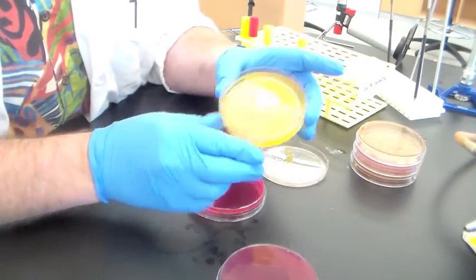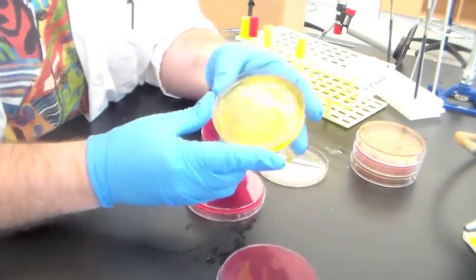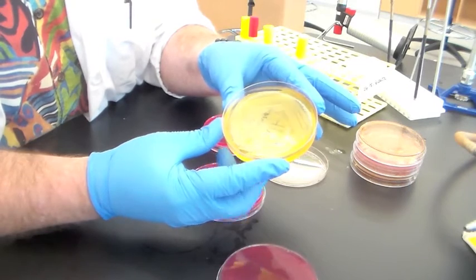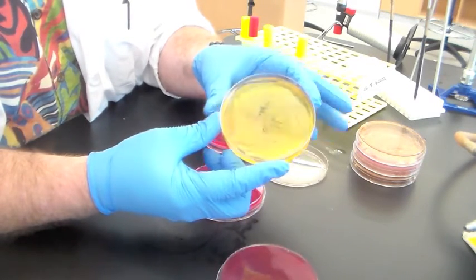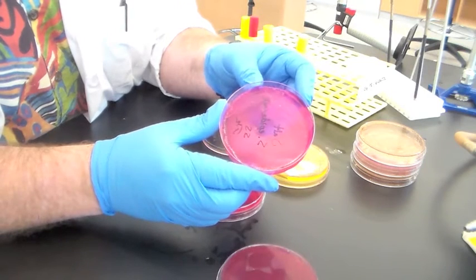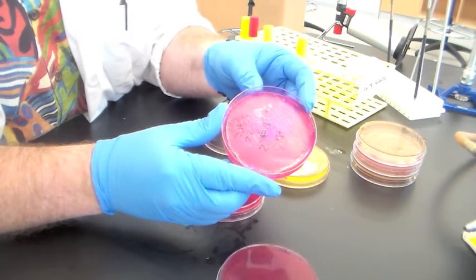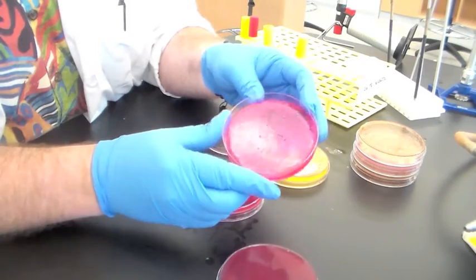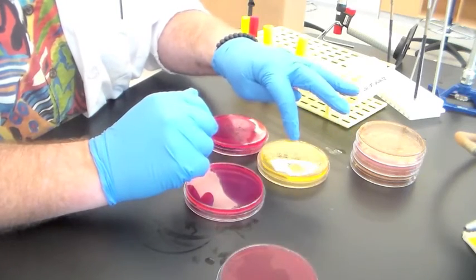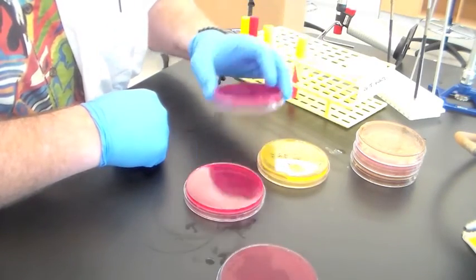When an organism is capable of fermenting mannitol, the pH indicator phenol red turns yellow. As opposed to other staphylococci which can grow on here but don't use mannitol — without the fermentation of mannitol, these microbes are probably growing based on amino acid hydrolysis or some other component. So you can tell this is likely a mannitol-fermenting staphylococcus versus one that is likely a staphylococcus but not a mannitol-fermenting one.